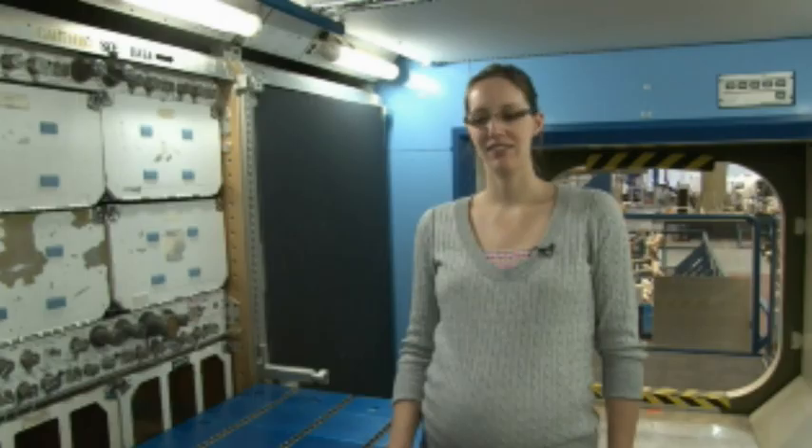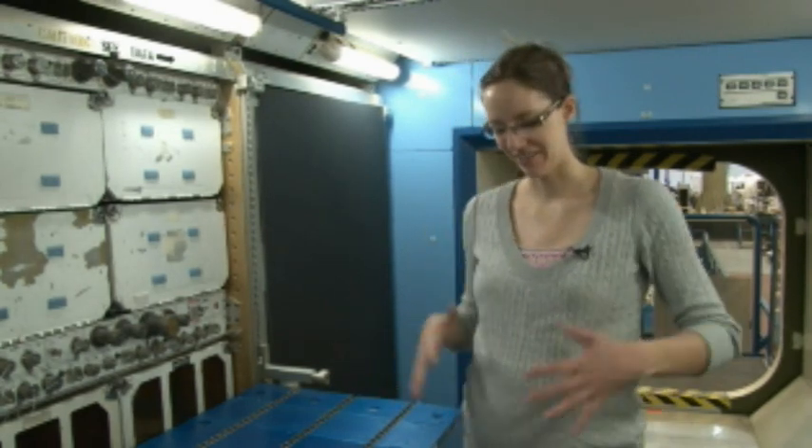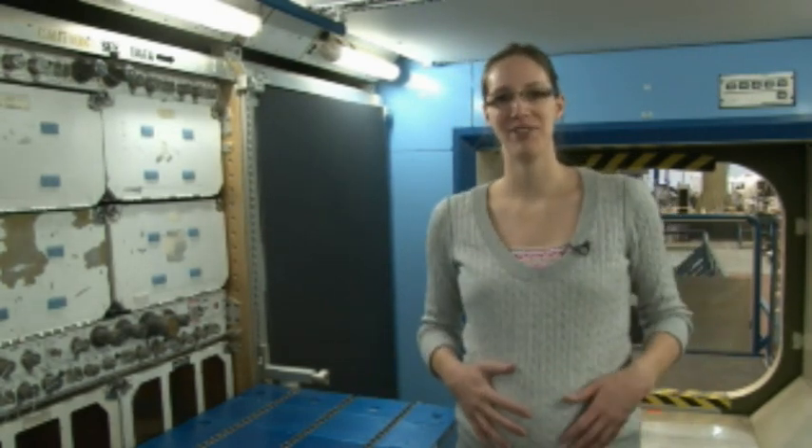This video is for the set up and tear down of the glove bag that is located in the wet lab kit. My name is Tessa Kirkendall and I have a little boy joining us for the training.